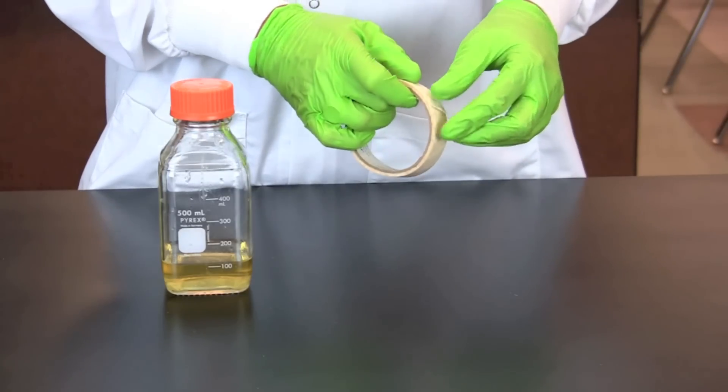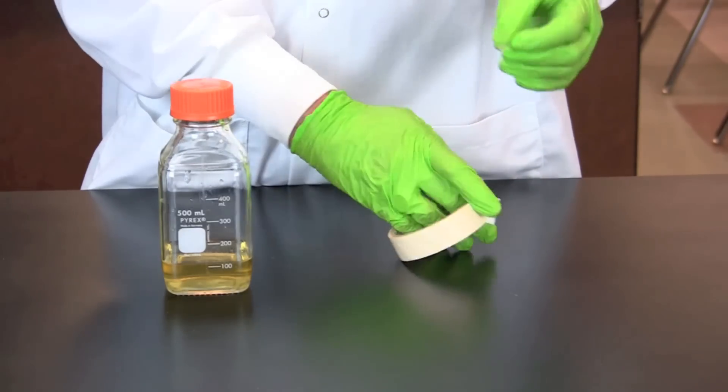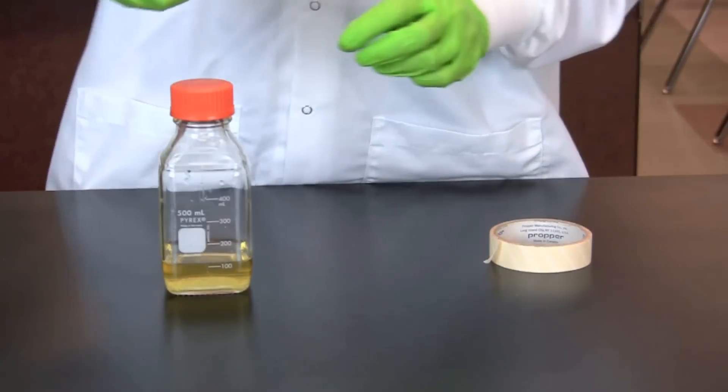When the medium is clear, put a piece of autoclave tape on the lid of the container ensuring that the lid is loose, then place the container into the autoclave.